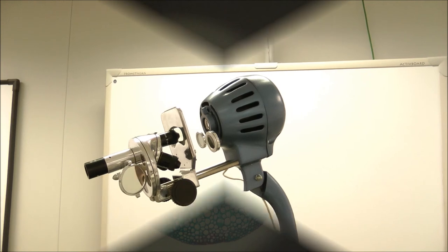Be sure that the revolving polarizing analyzer is out of the light path. And then you may rotate the revolving dust proof disc that contains your objective lens to achieve the magnification you wish. Remember to focus with the large knobs. And in general, the higher magnification you go, the darker the room will need to be.